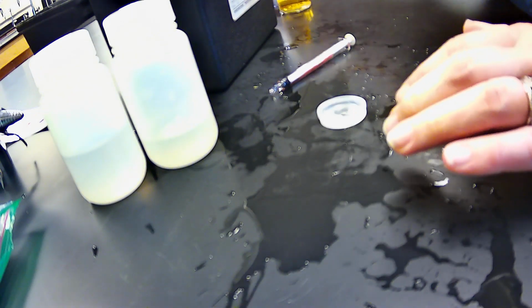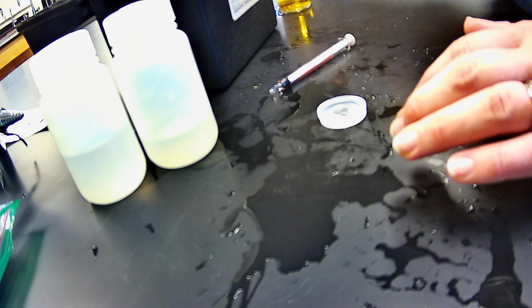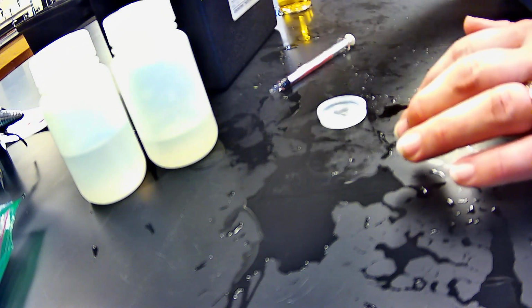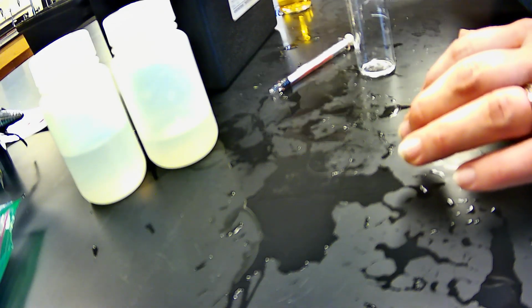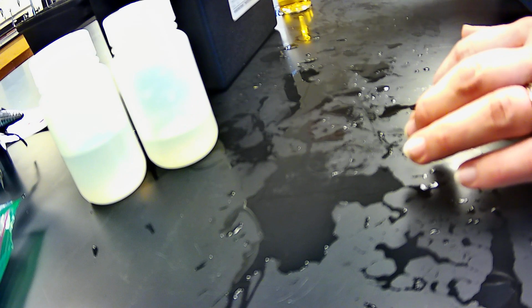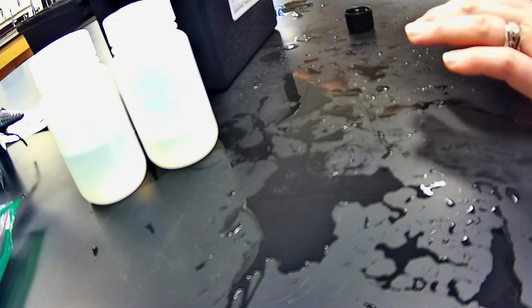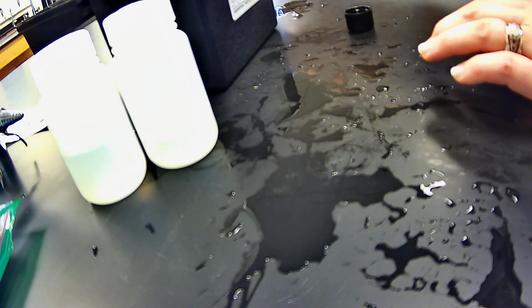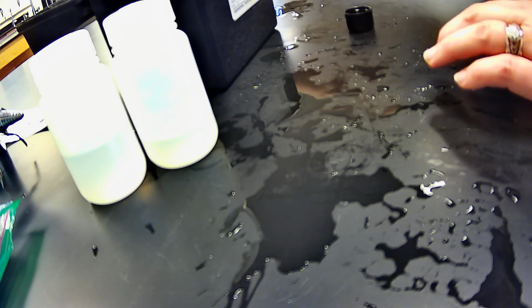Hopefully this has been helpful for those of you who can't be in person to do water quality testing, and I hope that this has been beneficial for anybody who's never done these tests before. Basically, I'm not going to lie, a lot of this stuff I'm just reading off of what the instructions tell me to, so it's not like I'm doing anything special or better than that, it's not like I've memorized these. So if you guys have any questions or concerns, please let me know.